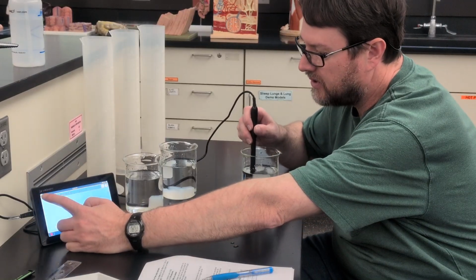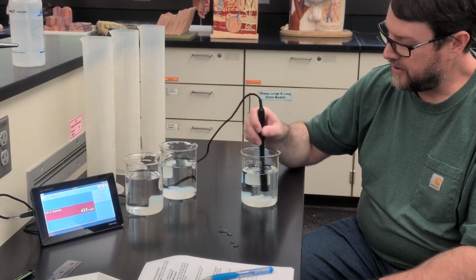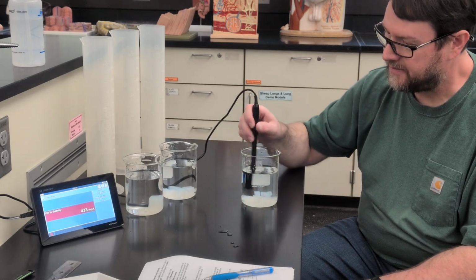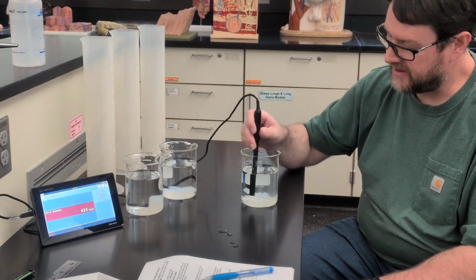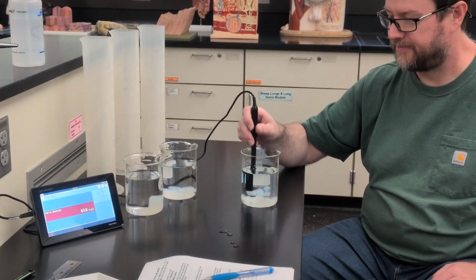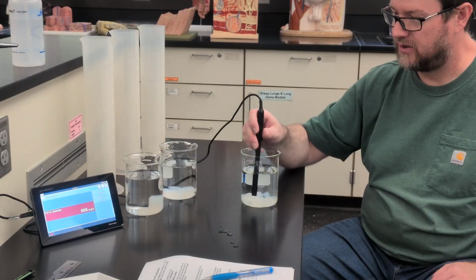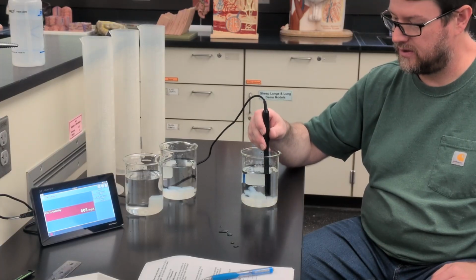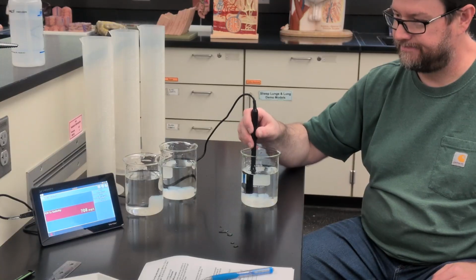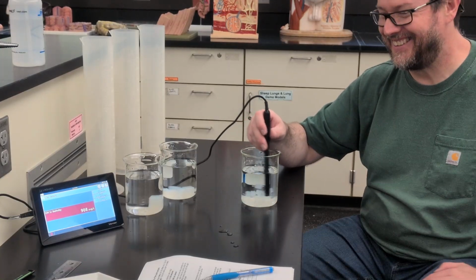Again, I'll switch over to the meter so you can see how that's going. And for the medium cubes, our value was 833. Let's see if the small cubes exceed that. Feel free to hypothesize while you're waiting.